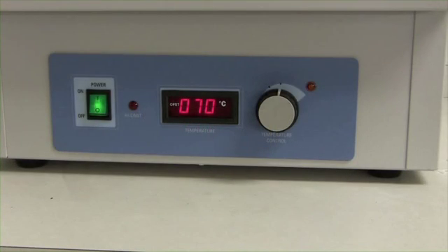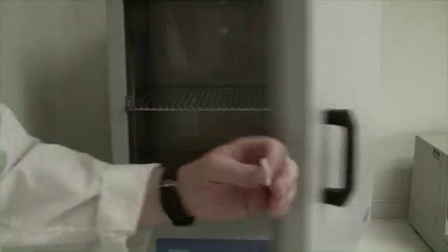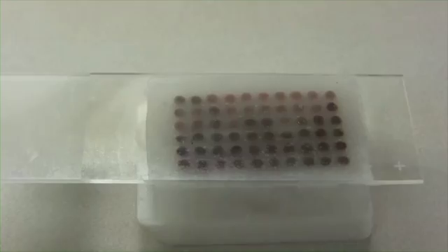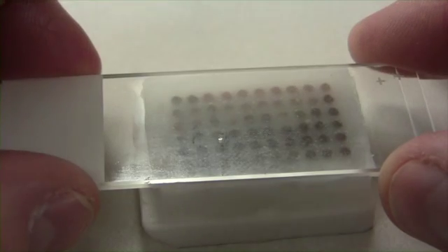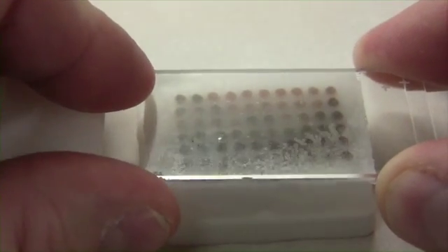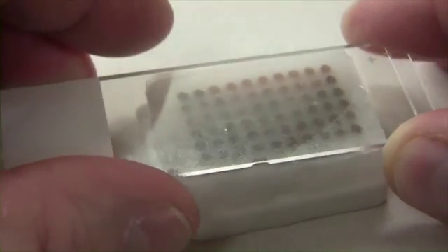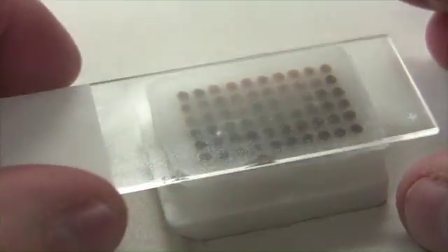You'll need to heat up another slide around 70 to 80 degrees Celsius by itself. Carefully remove the hot slide from the oven and place it on top of the slide that's stuck to the array block. You will see that the surface of the array block paraffin will liquefy. The two slides will be able to move around together. This sets the surface of the array block and gets rid of any air pockets.